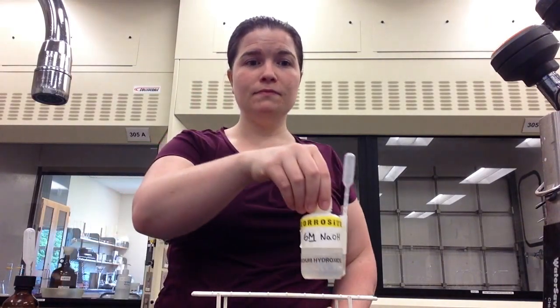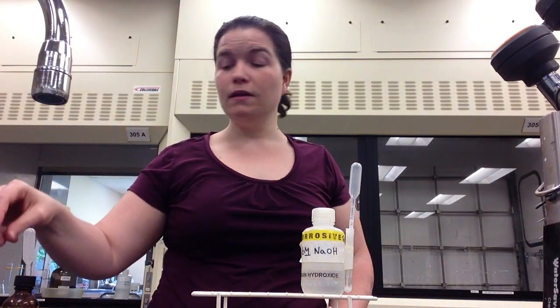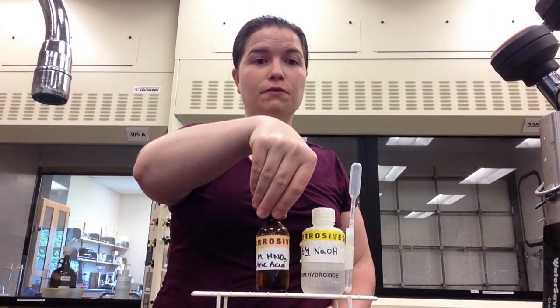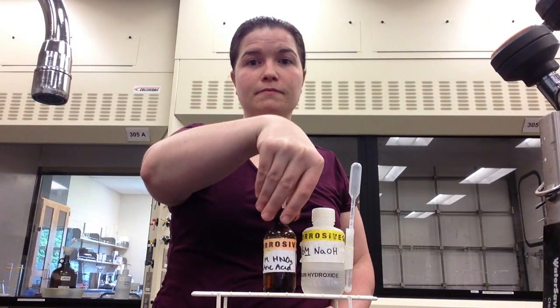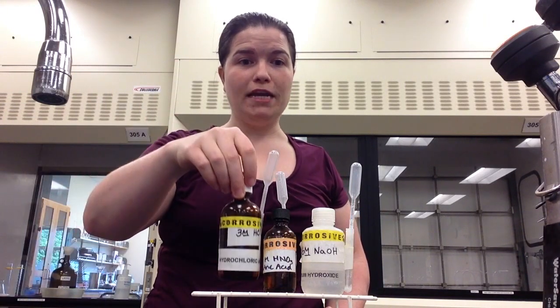In this lab, you will be using unknown and caustic chemicals, so safety goggles should be worn at all times. You will be using three caustic chemicals: sodium hydroxide or NaOH, nitric acid or HNO3, and hydrochloric acid or HCl.